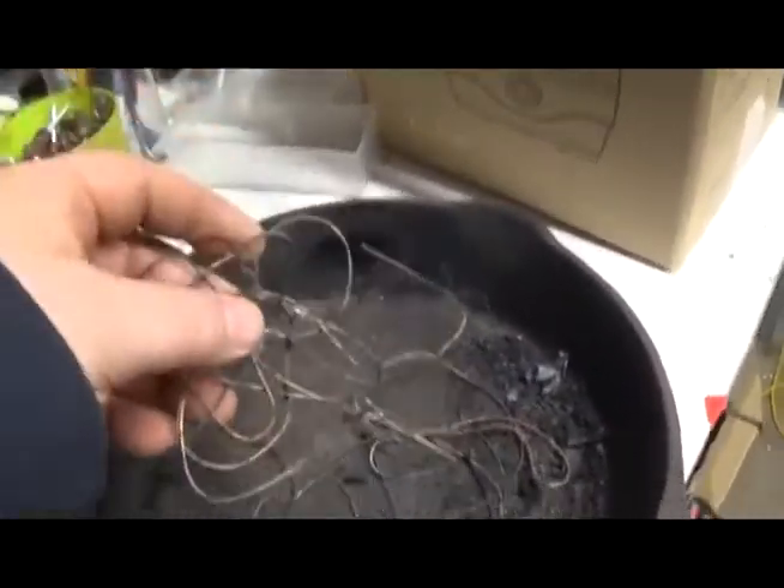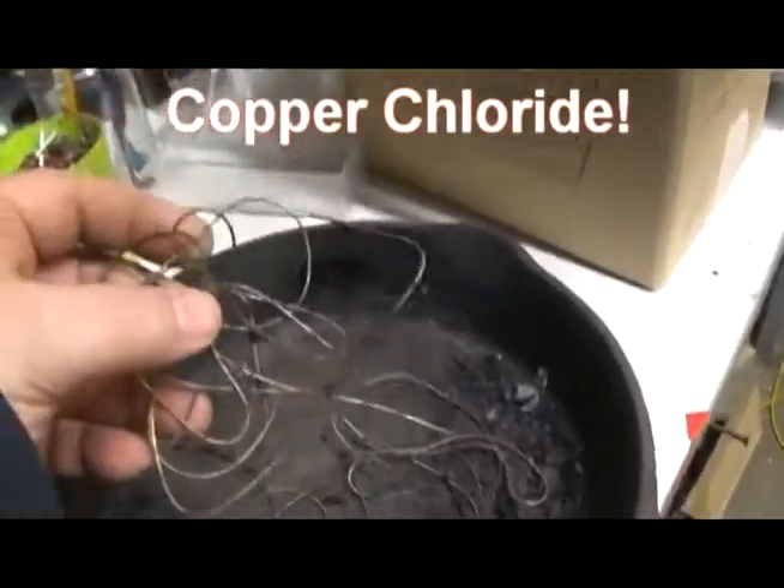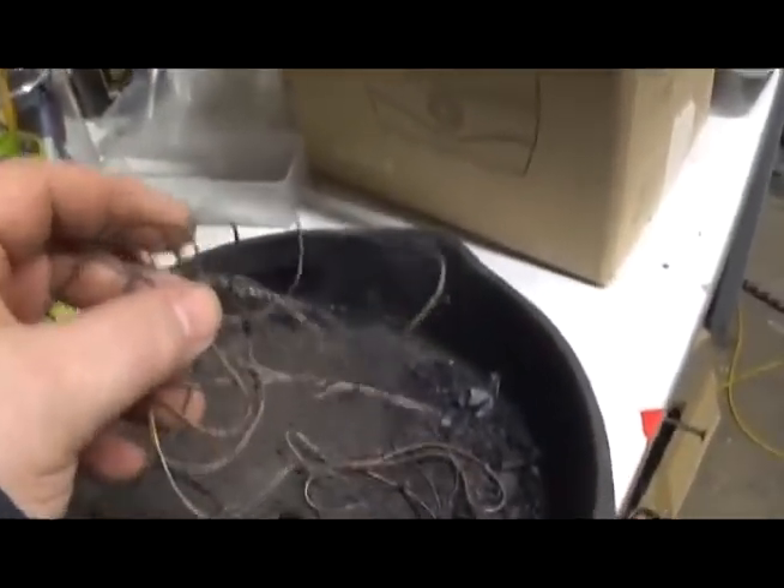So we cooked up a batch of copper oxide — oxide-coated, or oxidized copper. We're gonna take some of this, put it in the hydrochloric acid, and see if we can make copper chloride. We're gonna try it again. Here we go — I'm still a bit gun-shy. I'm gonna put one piece in and see if it starts to react very violently.